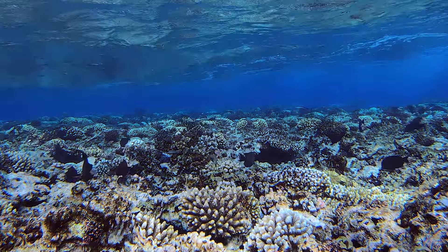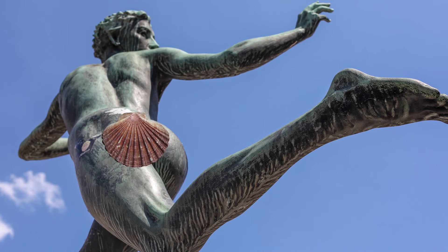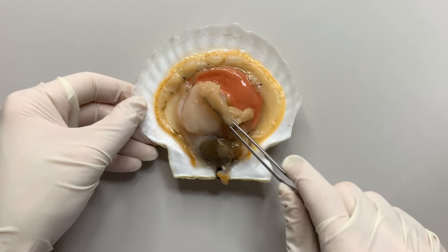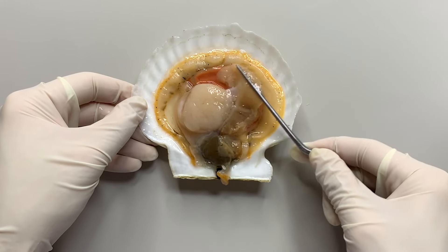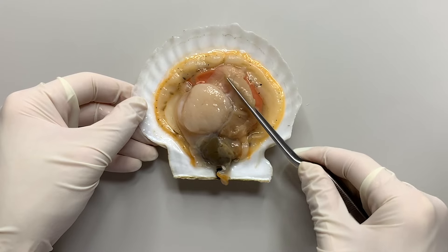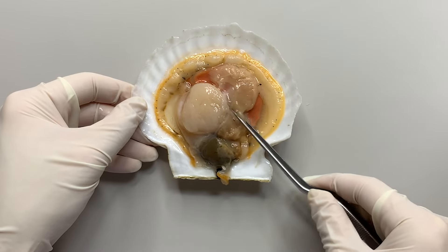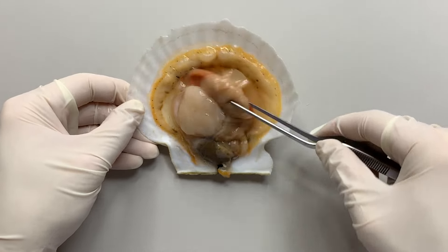If they don't hide in the soil, they are at greater risk of being eaten by predators. But scallops have the ability to run away. Something that is around the scallop's adductor muscle is gills — it's on the other side too. Gills are used for breathing and feeding. Scallops use gills to filter food from the water, including plankton and organic matter.